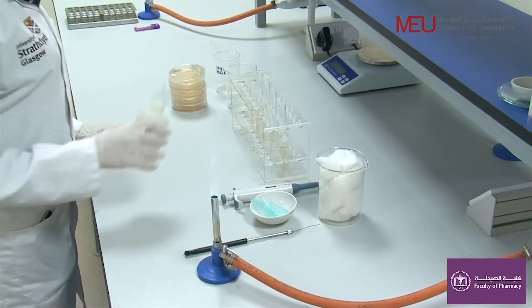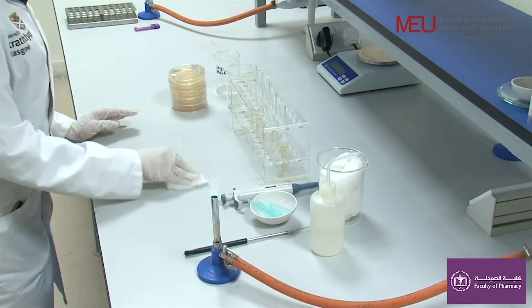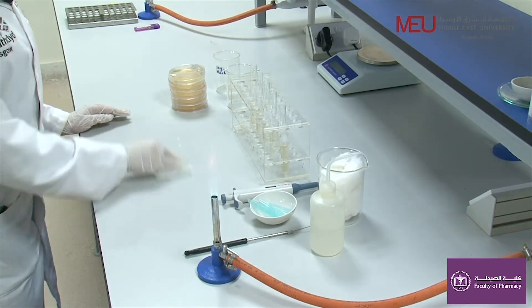Disinfect your working place by adding 70% alcohol and don't forget to open the Bunsen burner.